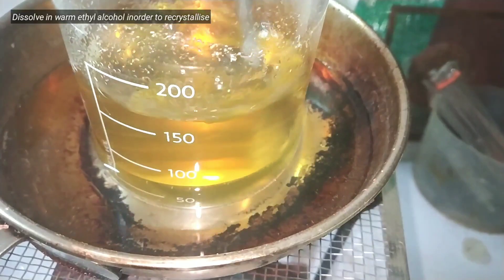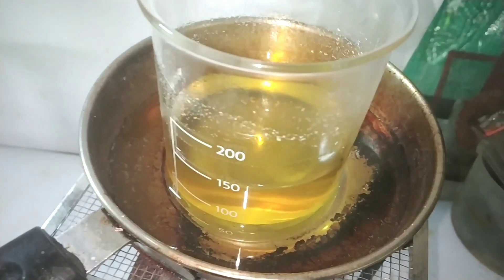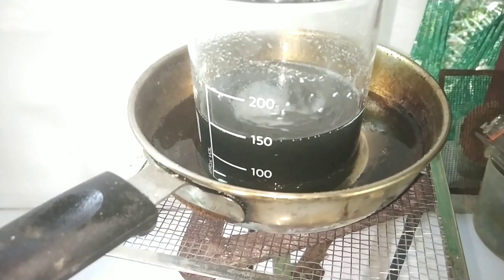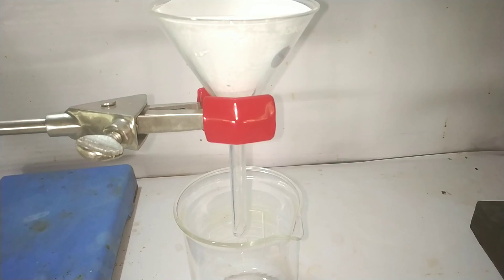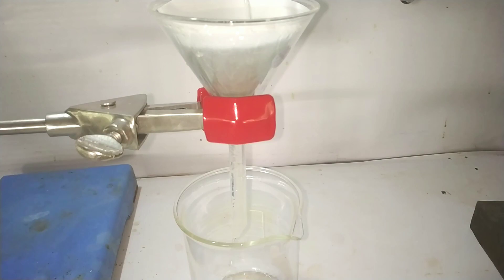Next, we recrystallize the compound from hot ethyl alcohol. In order to reduce the color, you can add some activated carbon — I added about 0.5 grams of it. The solution should be filtered while it is very hot to prevent crystallization from taking place in the funnel. Even though I tried, it did crystallize out a lot in the funnel, so I used some warm ethyl alcohol to wash down the funnel and the filter paper.